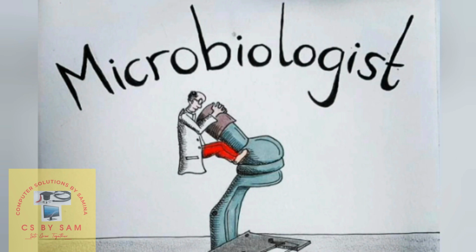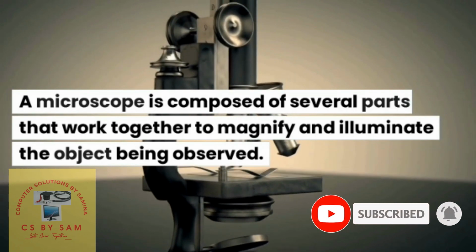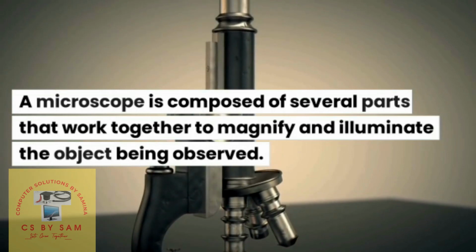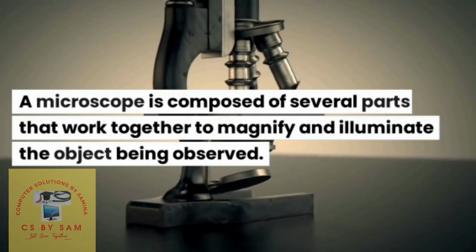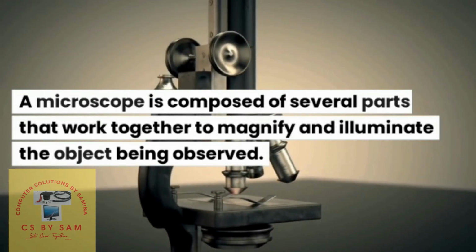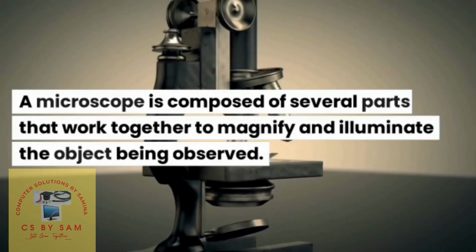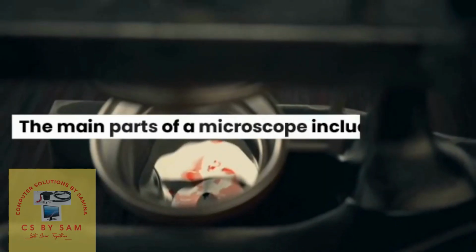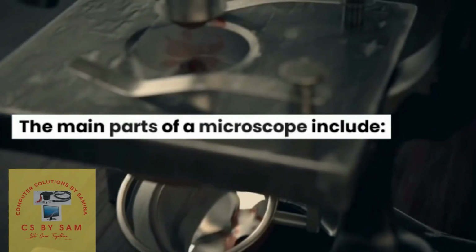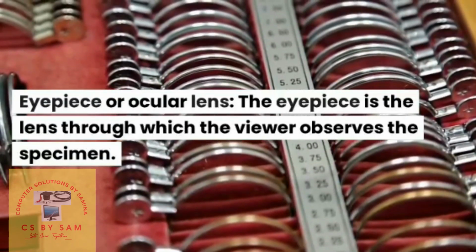The topic we are going to discuss is the compound microscope, or light microscope. A compound or light microscope is composed of several parts that work together to magnify and illuminate the object being observed. As you know, a microscope is used to observe tiny microorganisms. It has many parts, and the main parts of the microscope are as follows.